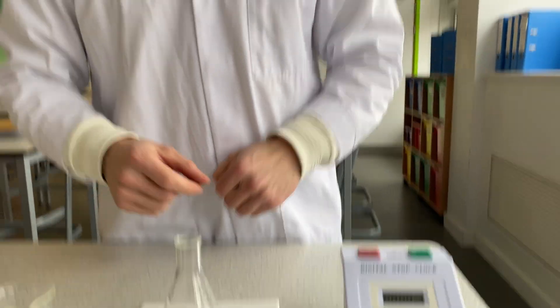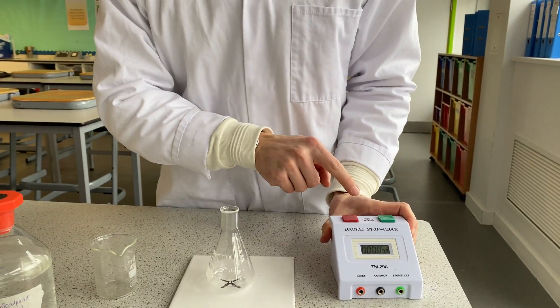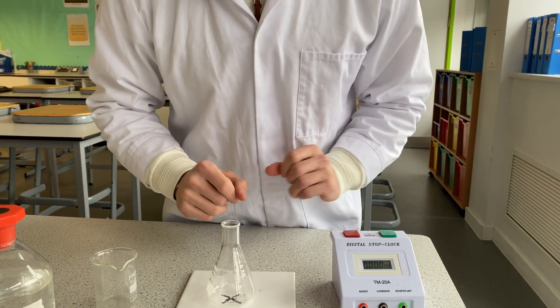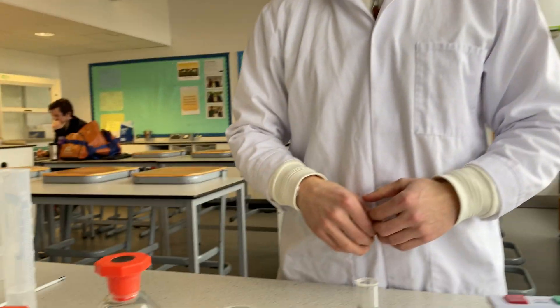We're going to time how long it takes for this cross to disappear. We'll mix the chemicals together and then start our stop clock. As soon as the cross disappears, we're going to stop our stop clock.